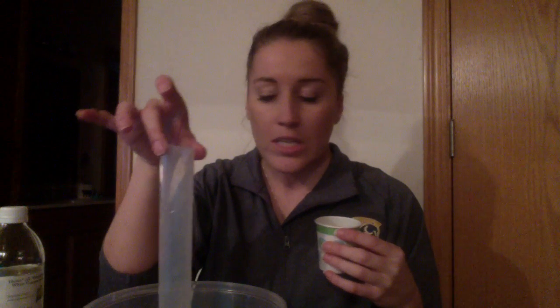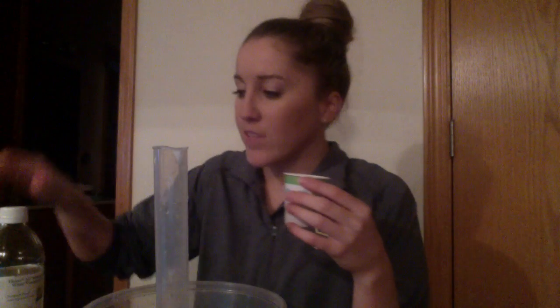Okay, so I went ahead and actually measured out 10 milliliters of vinegar. I already did that part, but basically I used our graduated cylinder, measured out 10 milliliters of white vinegar, and then poured it into this cup so that it was ready to go. Now it asks for a 50 milliliter graduated cylinder, but we actually have one that is 100. We're just going to take note and maybe even mark where our 50 milliliters is, because that is kind of important in the demonstration and the lab.